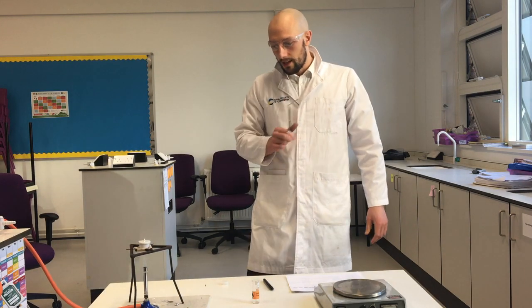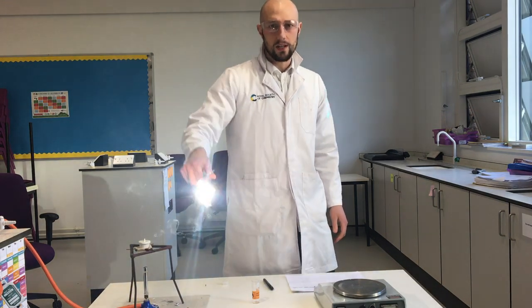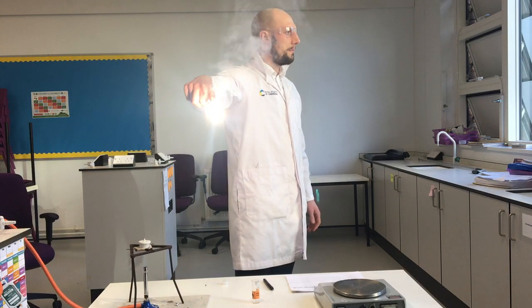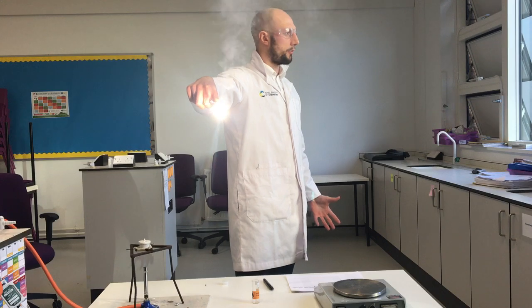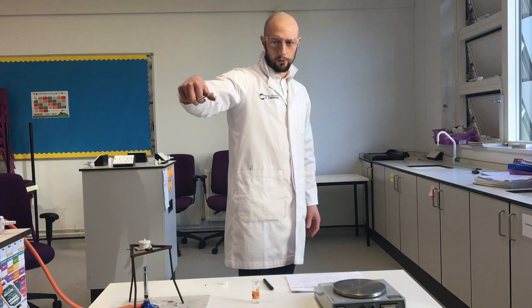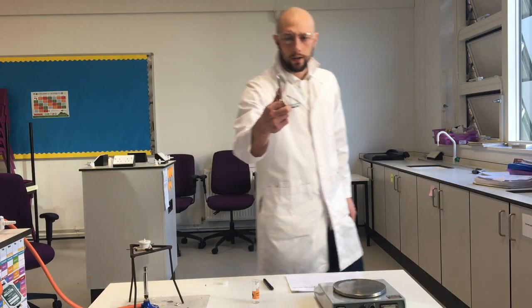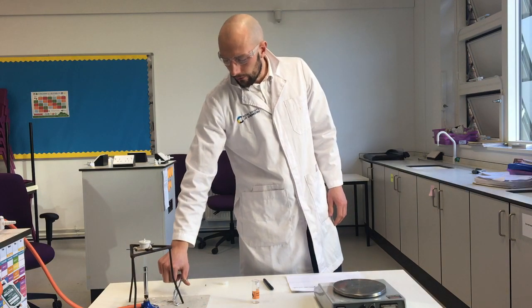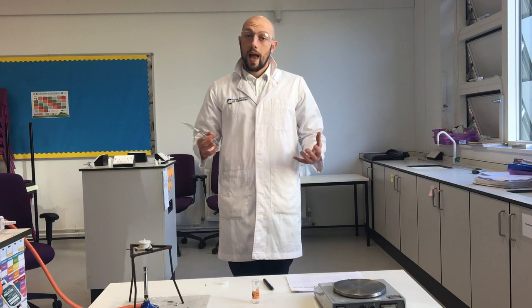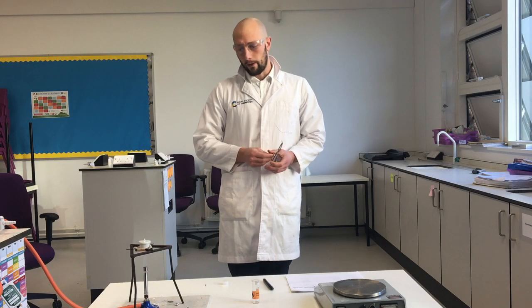I'm going to take some magnesium now. I'm going to get it burning, and I'm going to show you what it looks like when magnesium burns. Look at that. I'm going to look away because it's so bright. That is magnesium, very hot, reacting with oxygen in the air and giving off lots and lots of energy in a chemical reaction. What I've made is something called magnesium oxide. It's a white powder. It's a compound of magnesium atoms and oxygen atoms. They're chemically joined. Two different types of atom. Chemically joined is a compound.